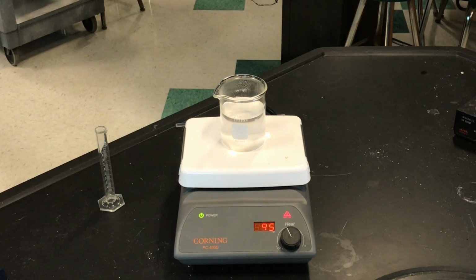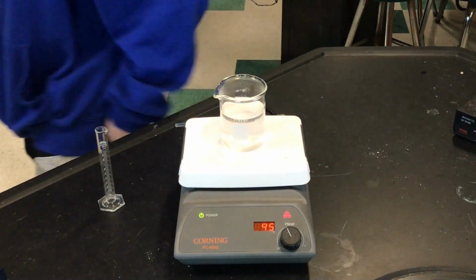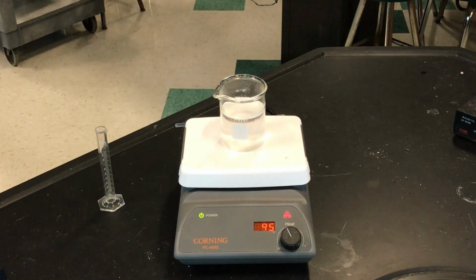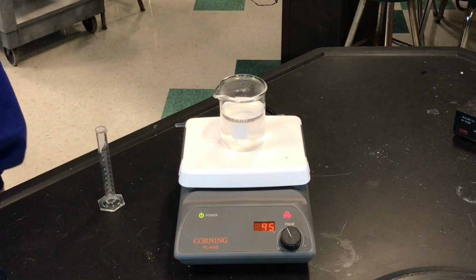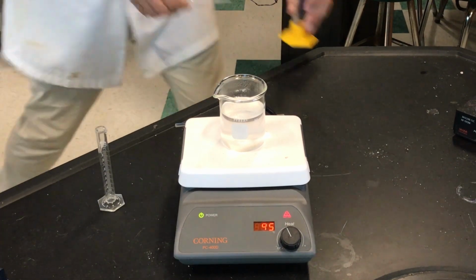Yes. And let me give you a graduated cylinder. You're going to do the same thing. So you need 44.5, so you need a bigger graduated cylinder. Let me get that for you. And a clean pipette. We're almost done. Tedious is the key here, but methodical.